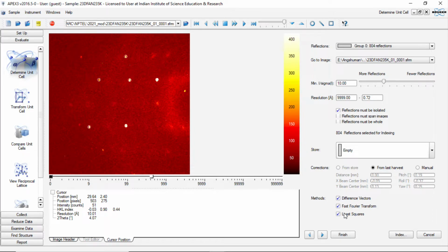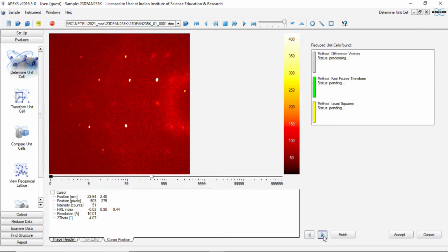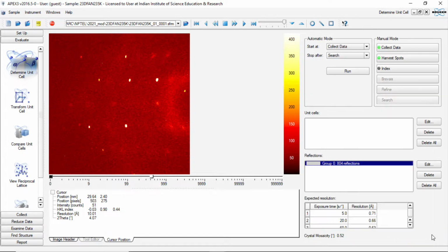I am saying that you use all the methods that are available for indexing and then try to index the pattern. You see the first method has failed, the second method has also failed, and the third method is struggling. It is not able to give anything. We cannot wait for an infinite amount of time, so we click cancel. What we have here is 804 reflections in this particular set of reflections.